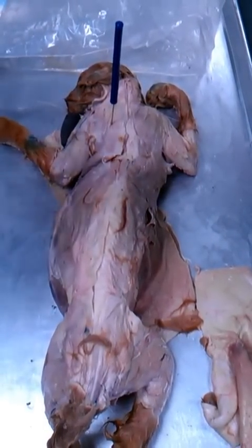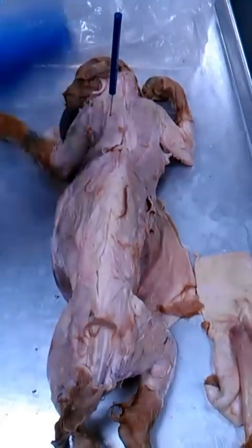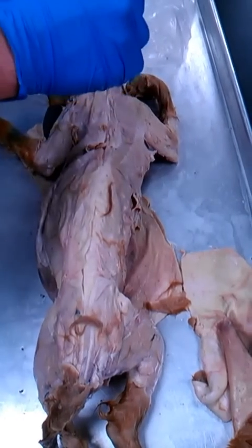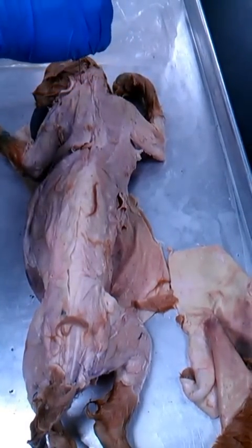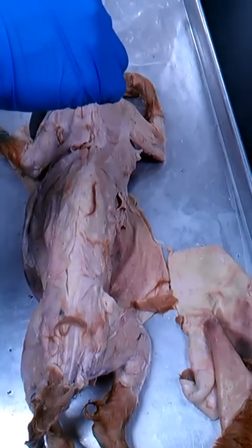The difference is where it's located, superior and inferior. So above the shoulder, again, clavotrapezius. Even with the shoulder, acromiotrapezius. Below the shoulder, spinal trapezius.